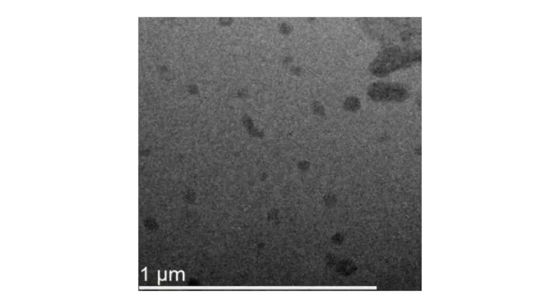The 4-meter tall transmission electron microscope that Ursel mentioned has an atmosphere that's very space-like. So it has a high vacuum, and generally things that contain liquids cannot exist. To look at the pharmaceutical crystals grow, I use a special holder that's basically like a transparent box. This encapsulates liquids and also gases so that the electrons can transmit through the box easily, and we can look at processes happen in front of our eyes.